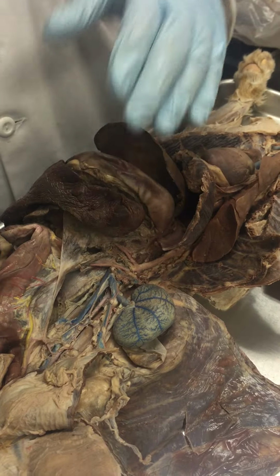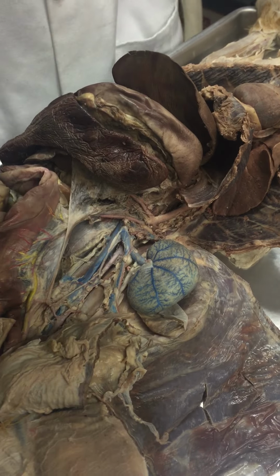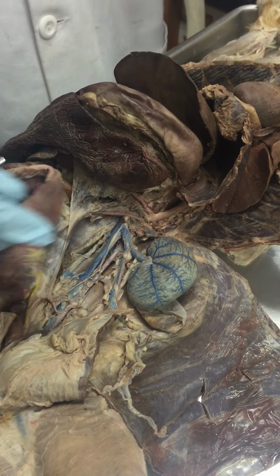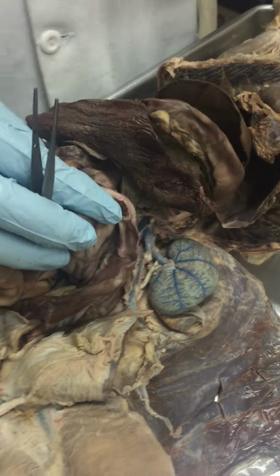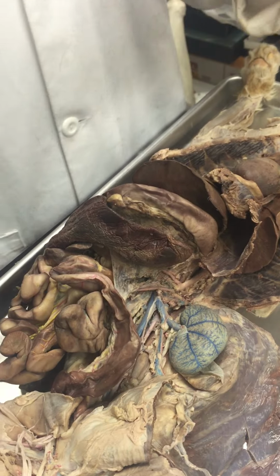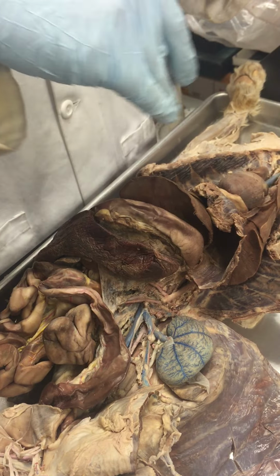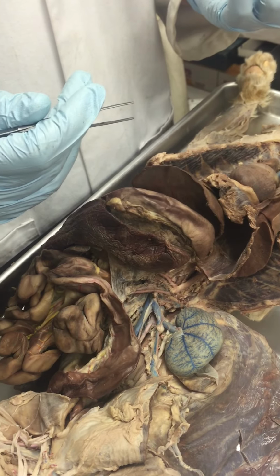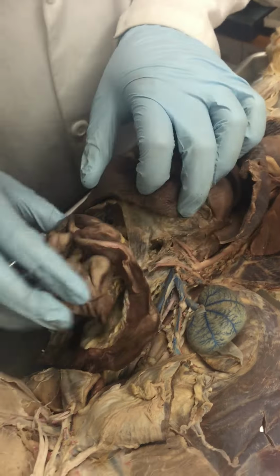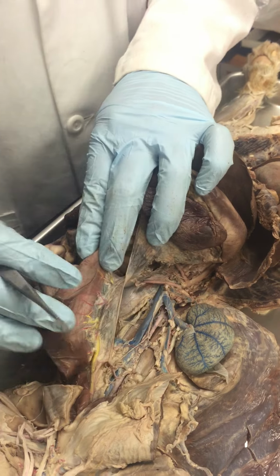On the vein system, it's a little bit different in this region. So usually you have an artery goes out and a vein comes back. It's almost parallel most of the time. But in the digestive system, all those arteries supply this region, but it does not go back in the same way. It goes through the hepatic portal system, returns to the liver, and then returns to the vena cava. Okay, so except the renal. It goes in, renal comes back.